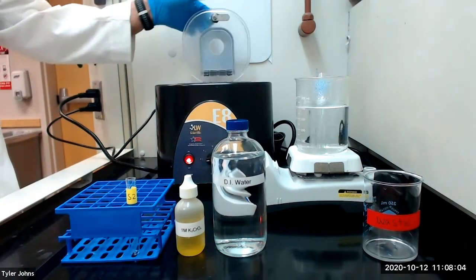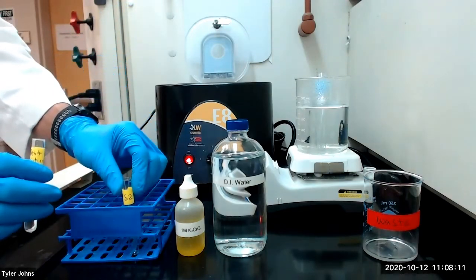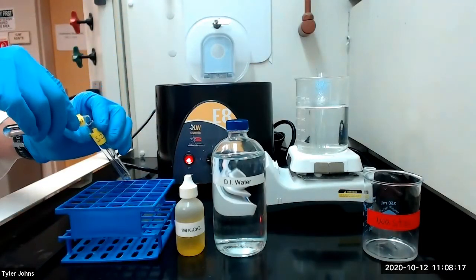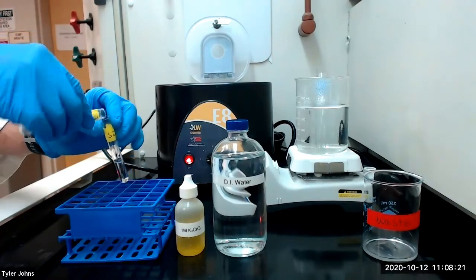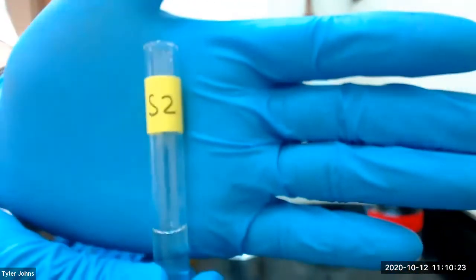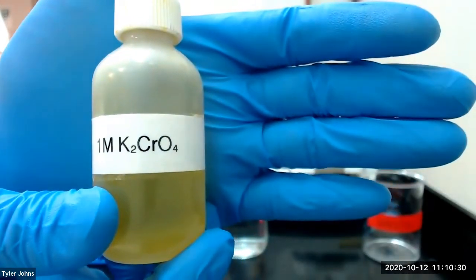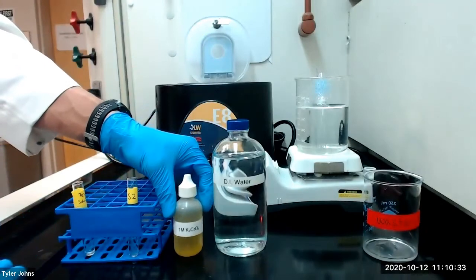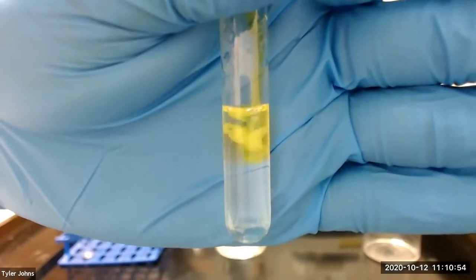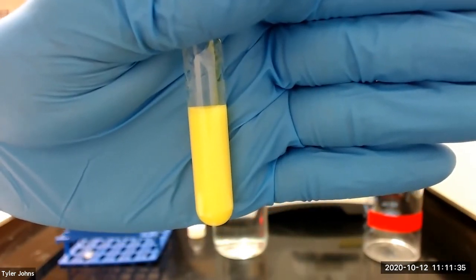After centrifugation has completed, we'll remove our test tube and decant the solution, which we will designate as S2, into a new test tube labeled S2. To our test tube S2, we will add several drops of one molar potassium chromate. The formation of a yellow precipitate will confirm the presence of lead ion. This is a confirmation of the presence of lead ion.